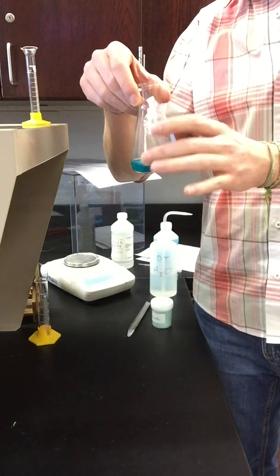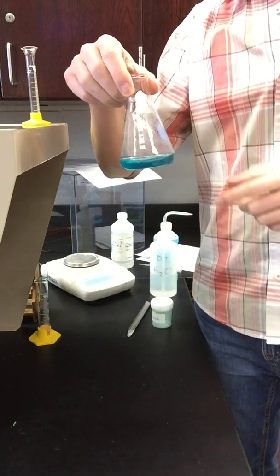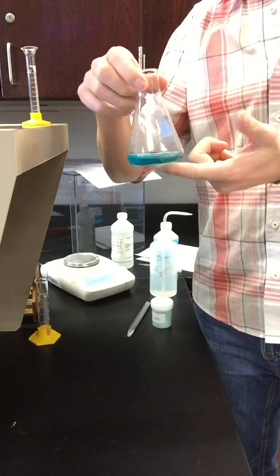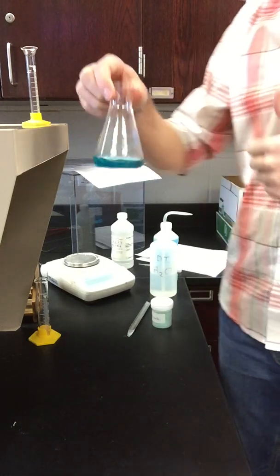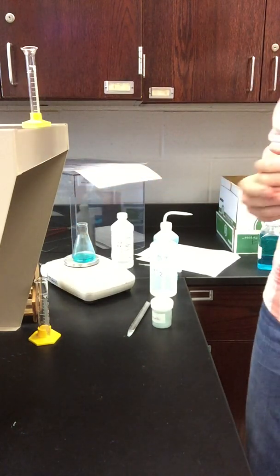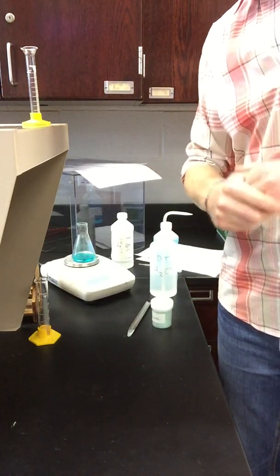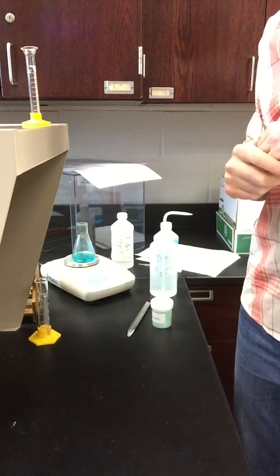Now, while that's been going on, our part 1 flask has had the opportunity to release gas. Now that the reaction is complete, because we've let it sit for a while, I'm going to get a new mass of this. After we weigh this again, the CO2, remember, has gone away. So the new mass of this flask is 90.324 grams. And again, that should go up in your part 1 data table.